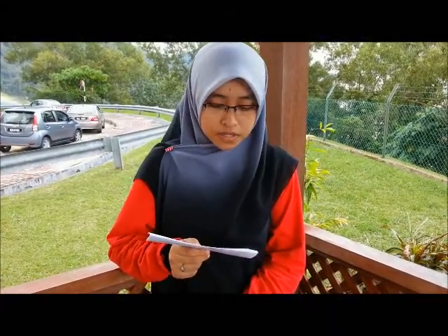In this experiment, we observed that the percentage of hemolysis in hypotonic solution is 57%, 0.59% in hypertonic solution, and 1.49% in isotonic solution. The percentage of hemolysis is relatively higher in hypotonic solution compared to isotonic and hypertonic solution. Besides, the color of the supernatant in hypotonic solution is red, while clear in both hypertonic and isotonic solution.